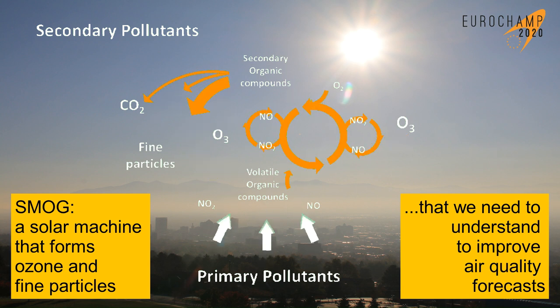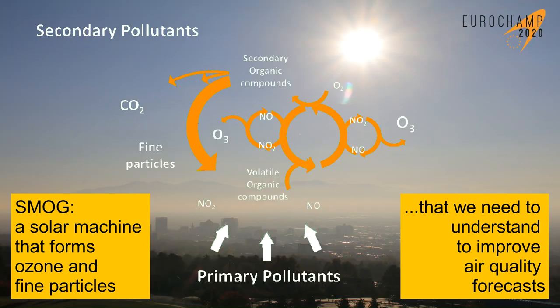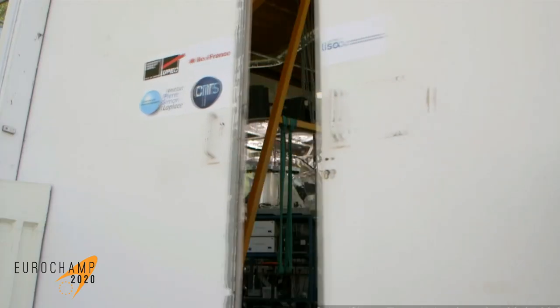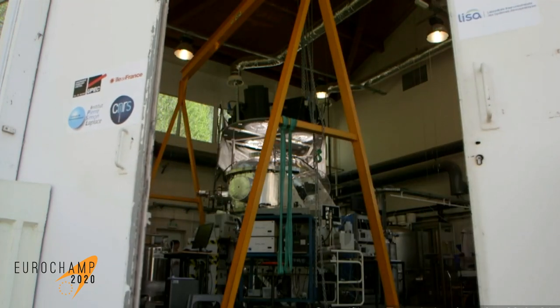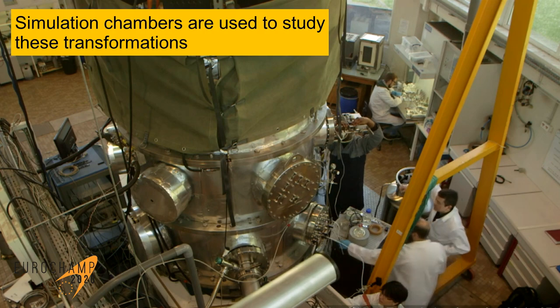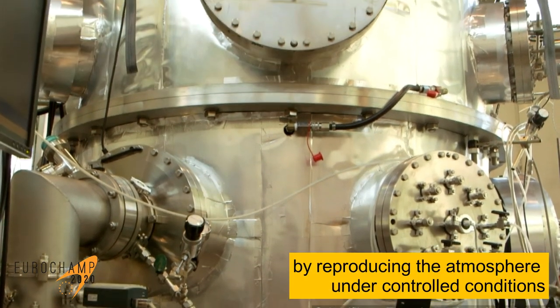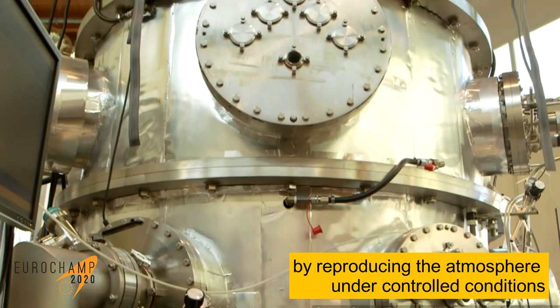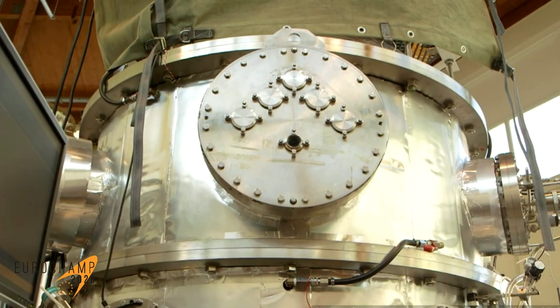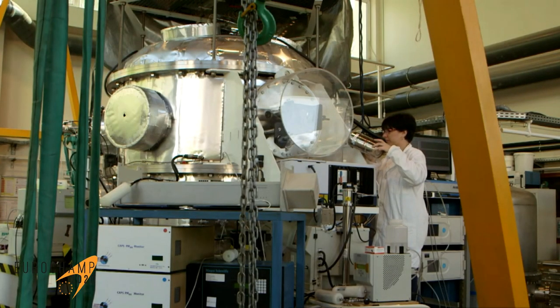To be able to forecast secondary atmospheric pollution, we desperately need quantitative information about each precursor. To do so, atmospheric chemists use very large installations where they can reproduce a well-controlled atmosphere and study the transformation of the pollutants without being disturbed by the continuous change of the weather, emissions, and the dispersion of the air masses. Today, we will follow one of these experiments, conducted in an indoor simulation chamber.